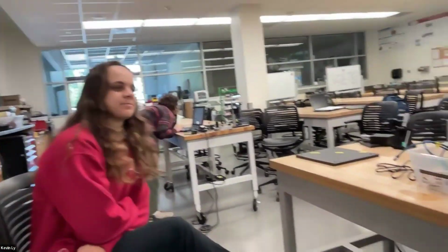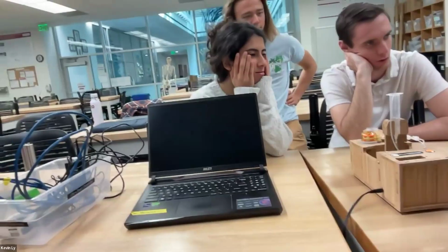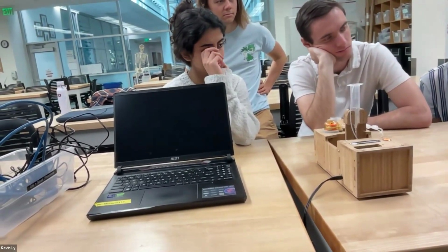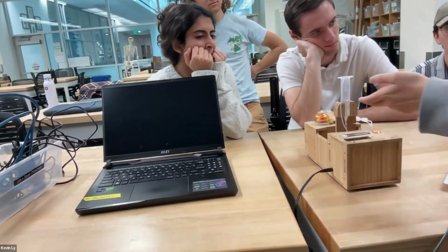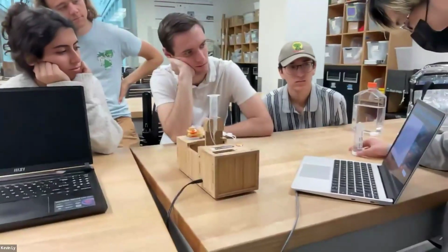Did you ever see any tardigrades or water bears? I don't think we've seen tardigrades in these samples. What magnification is this right now? I don't remember the exact number, but this usually is good for imaging particles from around 40 microns to 200 microns. Anything bigger and the particles kind of get clogged. Anything smaller and we don't really get high resolution images with the optics that we have right now.